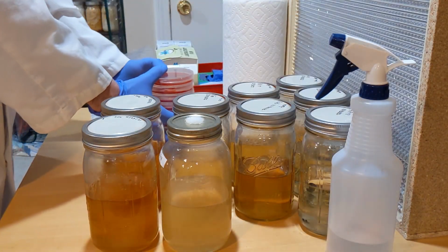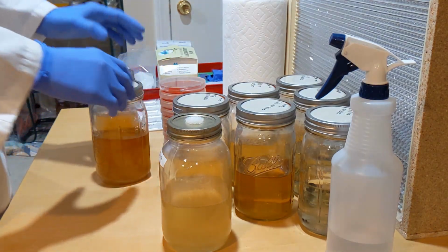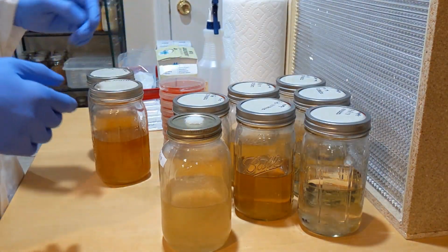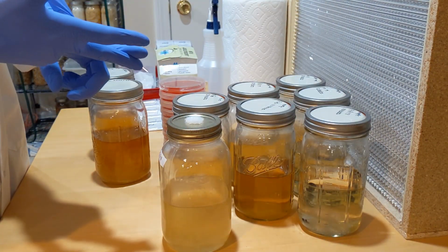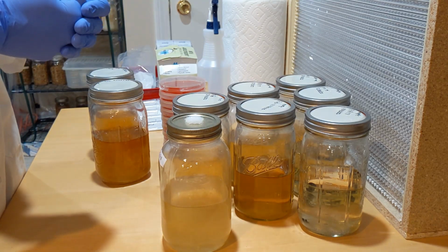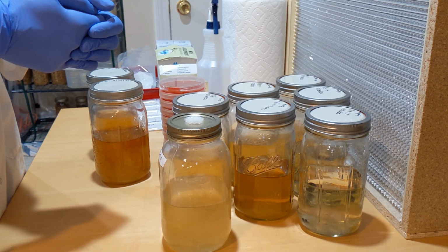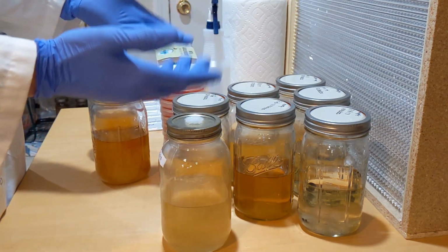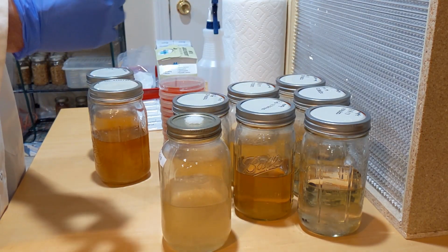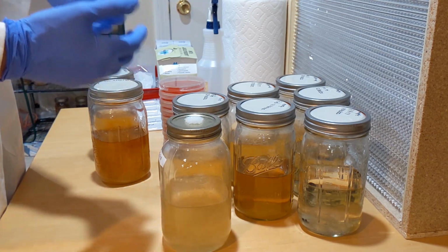So today we are back. We did that video where we made all those liquid cultures with the maple syrup, the honey, the light malt extract, and the Karo syrup. And we've inoculated those as well, so they've each received some mycelium, and it's been about a week. So things have had time to grow.